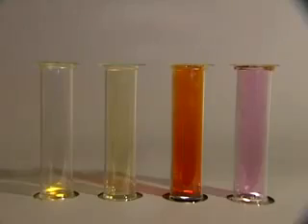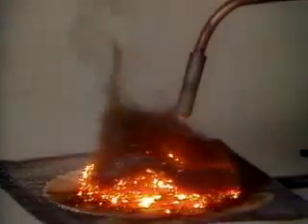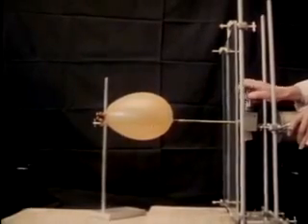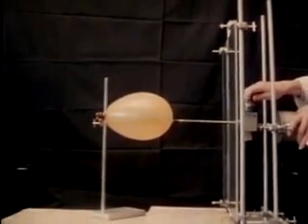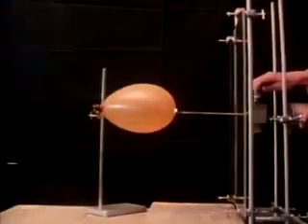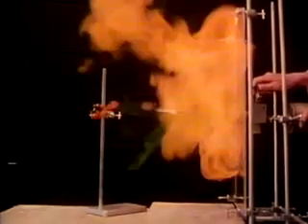Fluorine reacts, often ferociously, with almost everything else. A stream of fluorine instantly sets iron wool on fire, and it does the same thing to charcoal. Now let's see the reaction with hydrogen. There's hydrogen in the balloon. A jet of fluorine gas pierces the balloon and explodes with the hydrogen inside. Let's see it again in slow motion — now you can see the fireball more clearly.